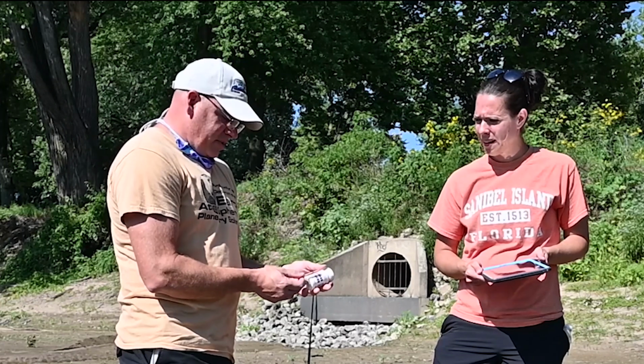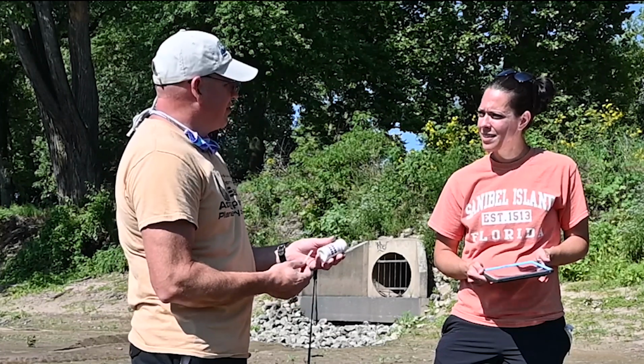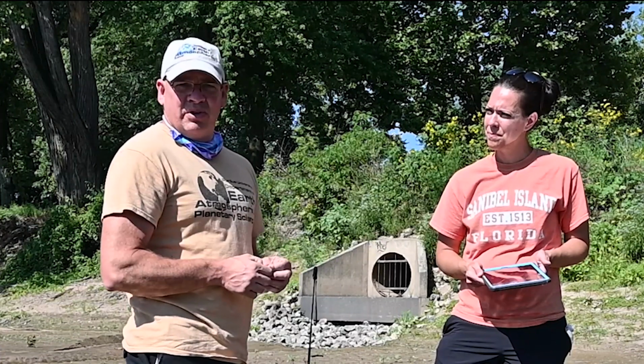I would put down, if it's slightly closer maybe to 8, and so, I mean, I would probably call this an 8.3 because it's slightly closer to the 8.5 on this. So I would call this test an 8.3. And so that's what we would record.